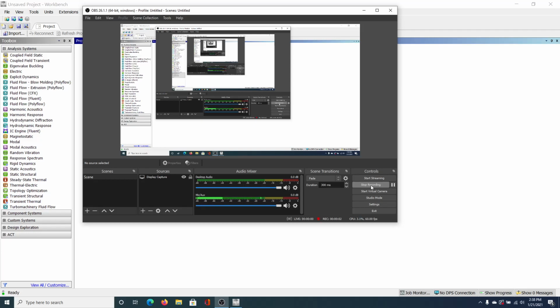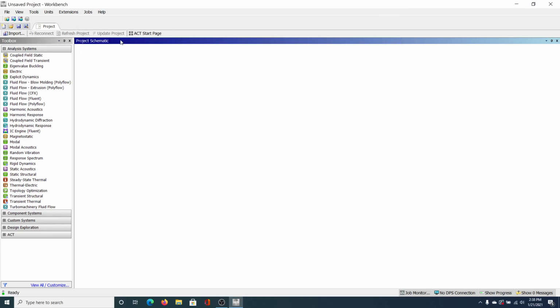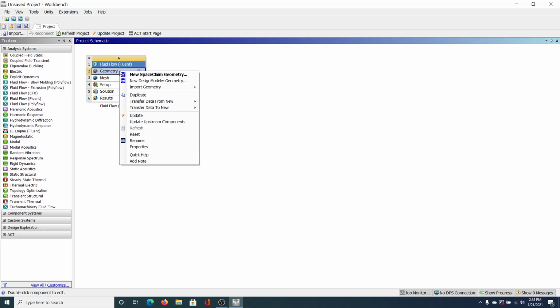Okay, so for this video, we're going to create a geometry of our microchannel. I've already opened up Ansys, and we're going to start by doing a fluid flow project, fluid flow, Fluent, okay? First thing we need to do is create a geometry. So we're going to right click and do Design Modeler, not SpaceClaim, but Design Modeler. So we're going to click that.